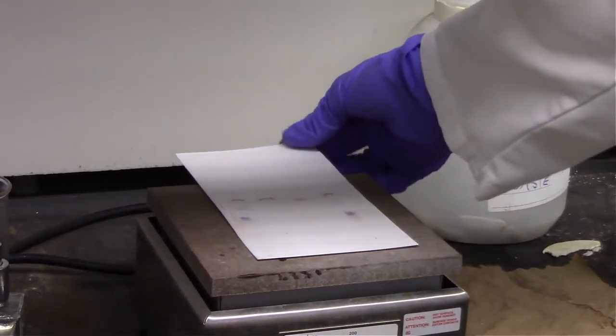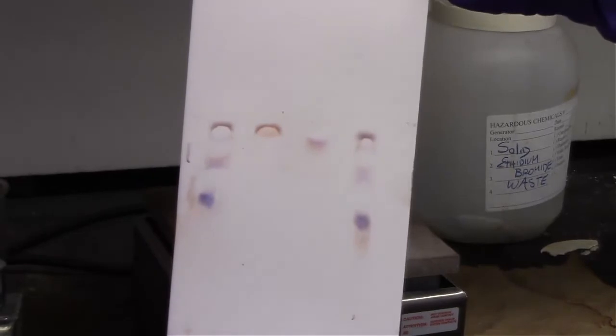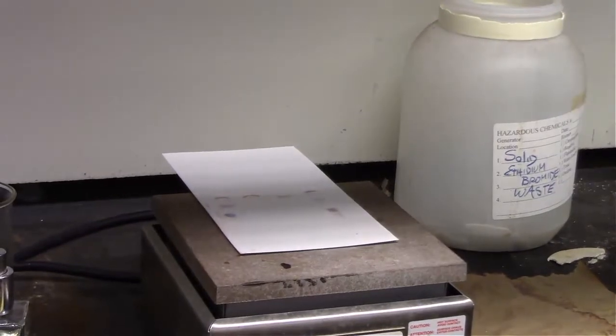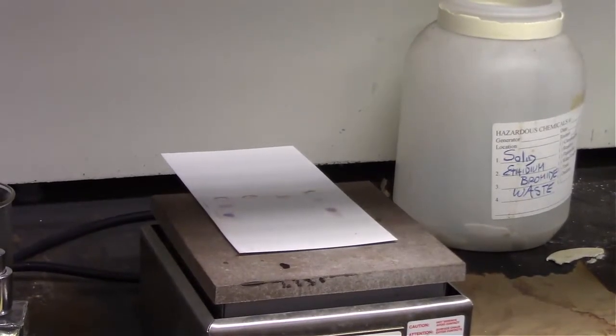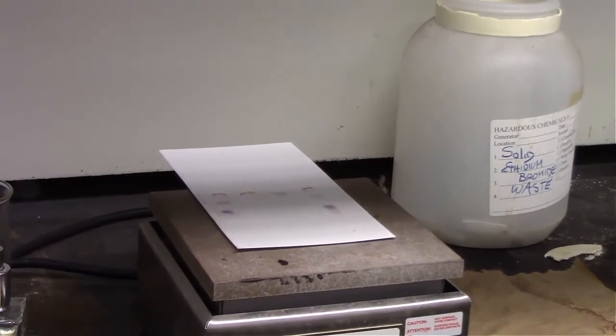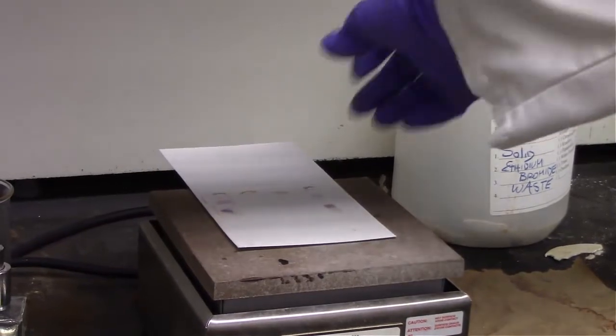And we're going to lift it up here just to give a slightly closer view. So again, you can see the 2 unknowns and you can see the molecular weight ladder. I think we can see almost all that we're probably going to get from our molecular weight ladder, as well as our 2 unknowns. And I think based on the way those line up with the molecular weight ladder, we should be able to at least figure out what our 2 unknowns are.